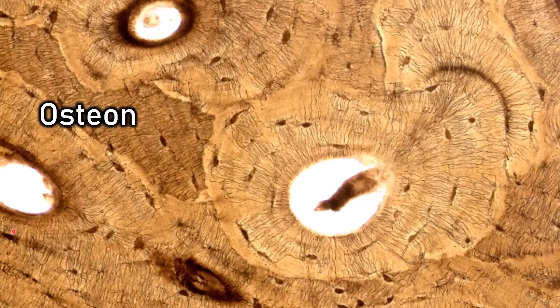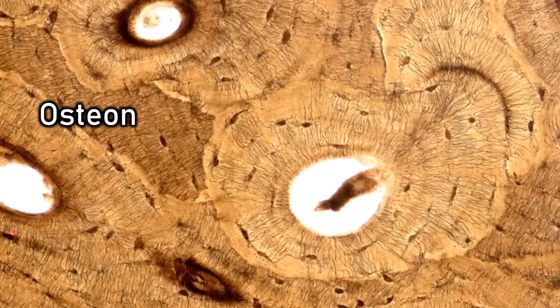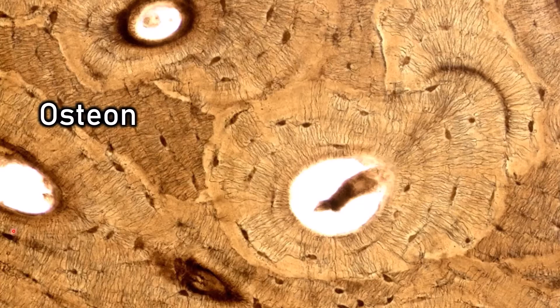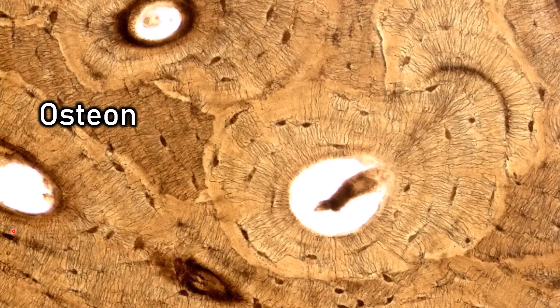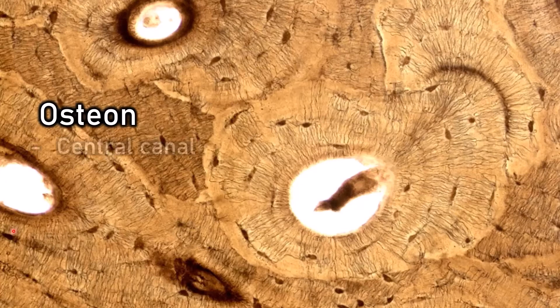Osteons have four basic parts. You see they all have that open space in the center. That open space is going to have blood vessels and nerves running through it, and it's called the central canal.